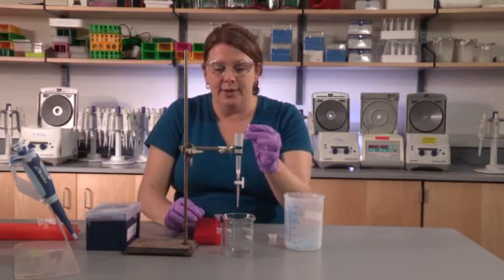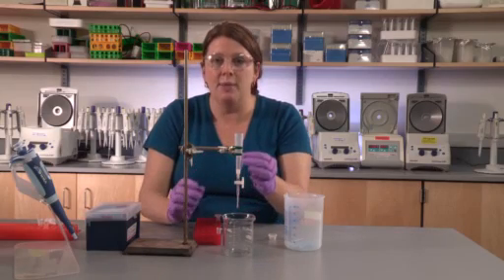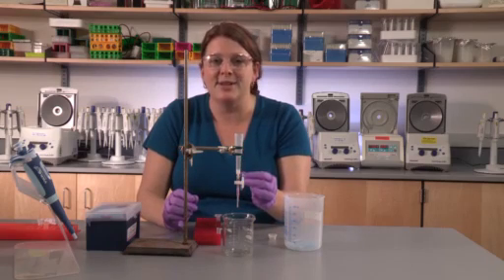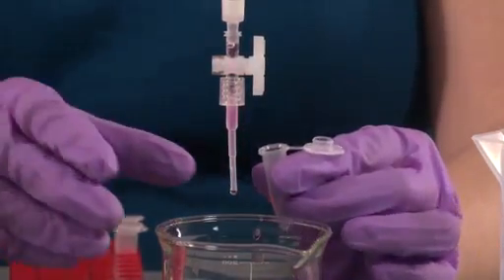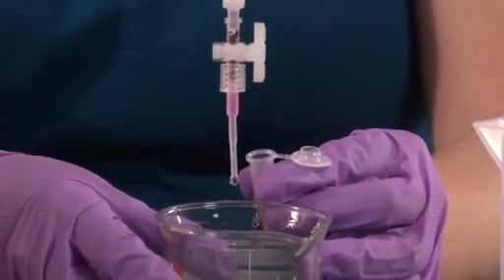Pick up a microfuge tube and be prepared to collect the sample that's now eluting from the column.